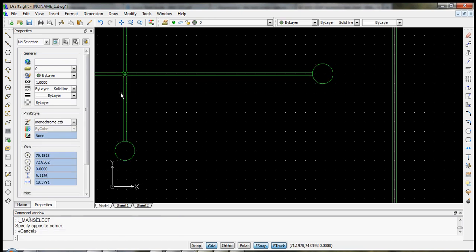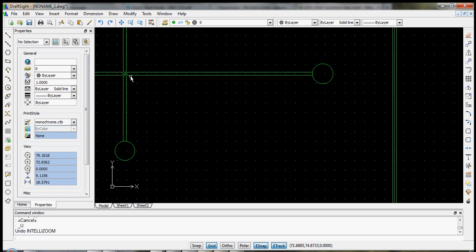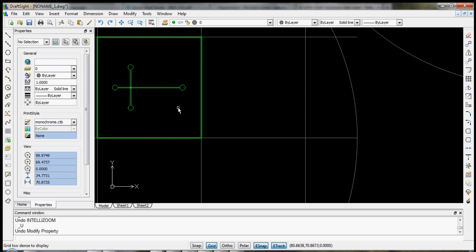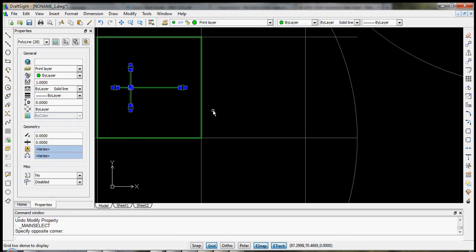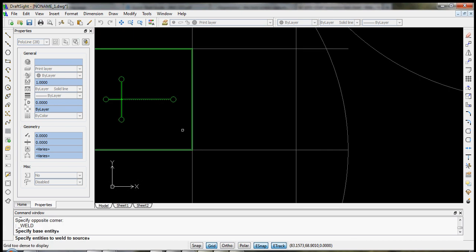okay, we said yes. Now look what happened. We got some really strange structures that didn't actually link together in the right way. We'll hit Control Z to remove that, and we'll try something different. Let's weld these all together. So we can type the word weld, or use this icon with two arrows pointing together. It first asks for a base entity. We can just pick any of those lines. Then it says specify the ones to weld to that one. Select everything else, and we'll do enter.